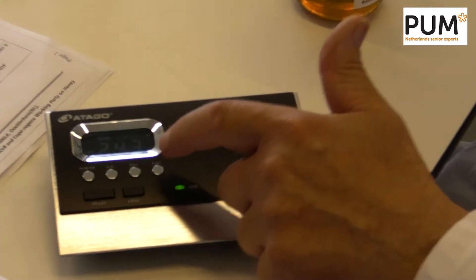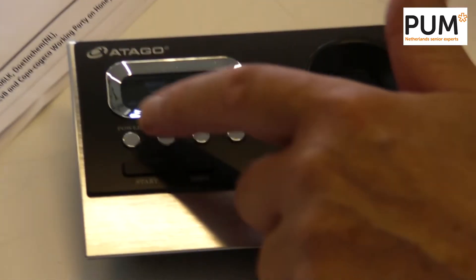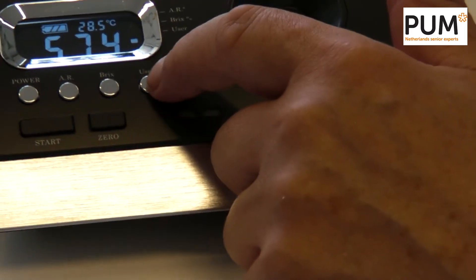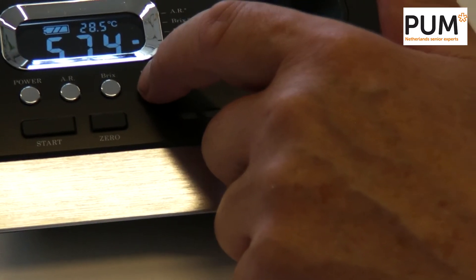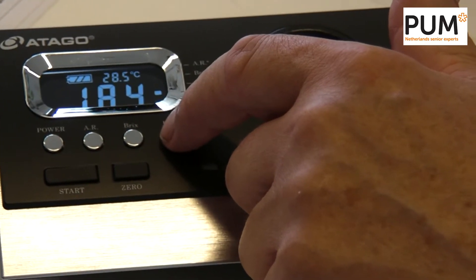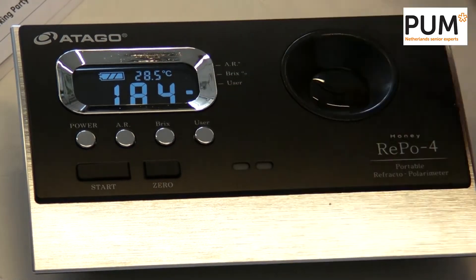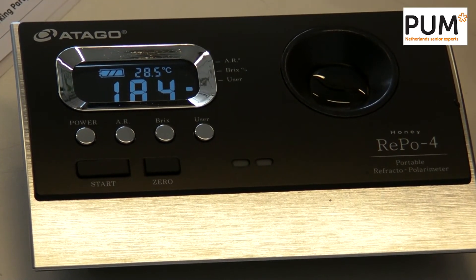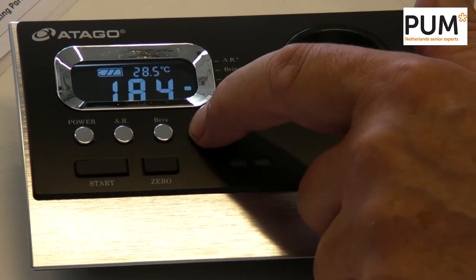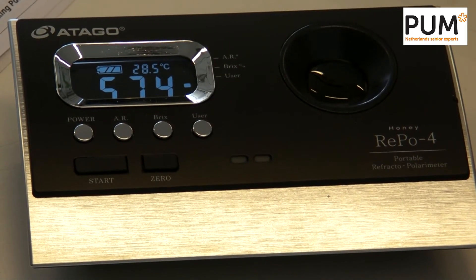A second thing you can do with this machine — using the button completely to the right — is measure the fructose and the moisture amount. The moisture amount of this honey is 18.4 percent, as the display shows now. And the fructose is 57.4 percent.